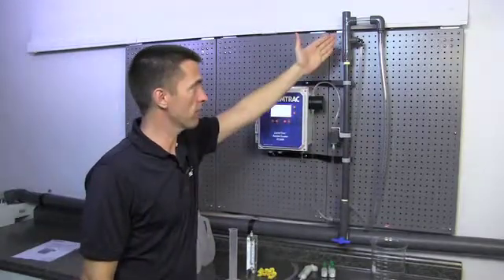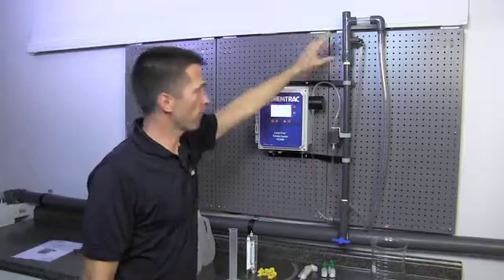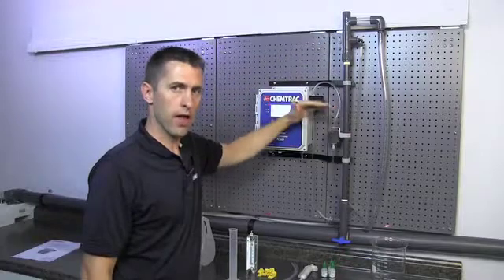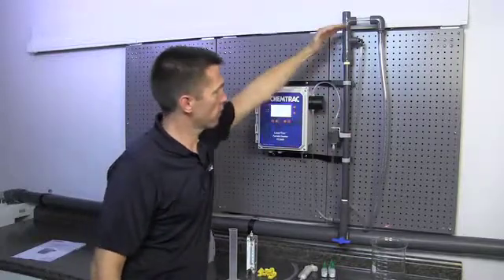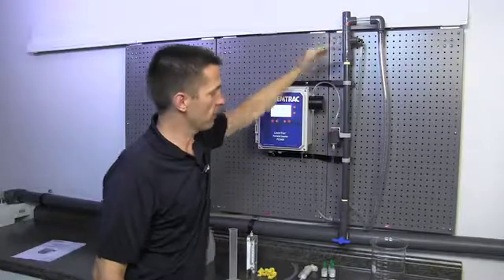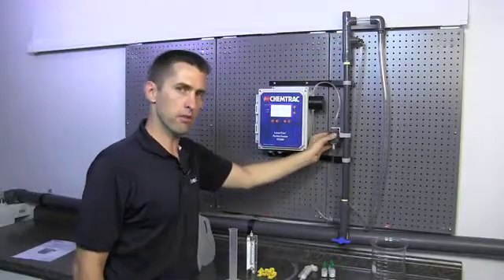At the top of the weir we have our overflow, and it's important that the sight glass remains about half full so that we have this constant head differential. The head differential exists between the top of the weir where it overflows at the sight glass and wherever this drain cup is positioned.